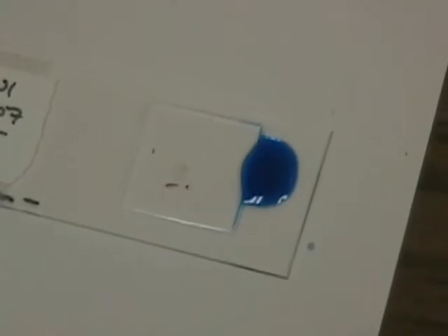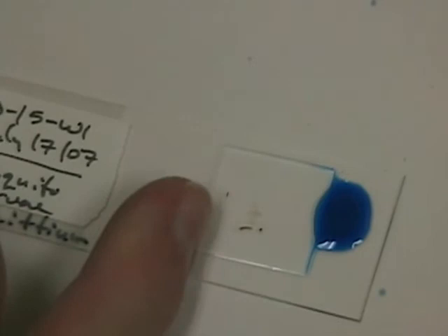So what we're going to do here is bring this slide along and let this infiltrate. This infiltration can vary depending on the amount of water that's on the slide when you start, but you can see it's starting to infiltrate already. This will probably take anywhere from 10 minutes to a half an hour.